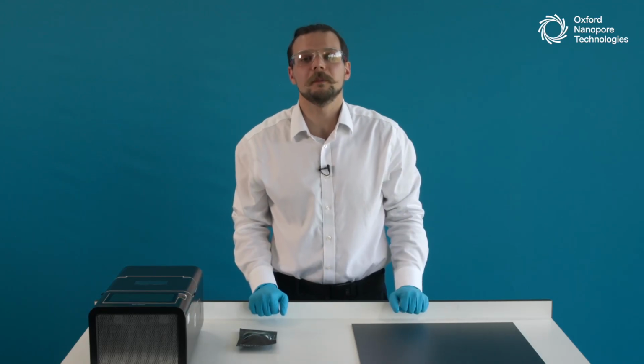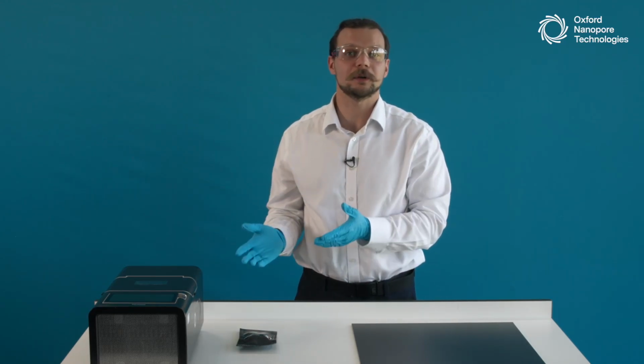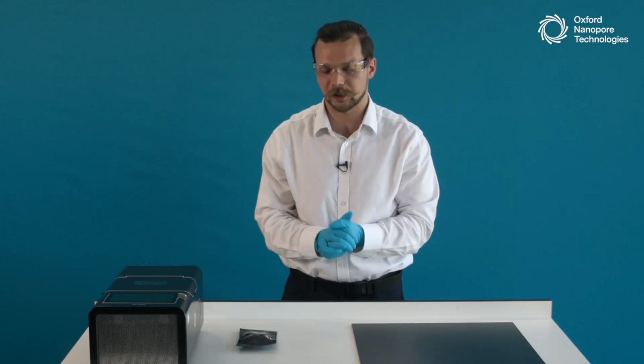Welcome back. Hope the MinION Flow Cell loading video was nice and clear, and I think now we can proceed to the final part of this masterclass, the one that you've all been waiting for, where we take our flow cell demo packs and load the flow cell together.